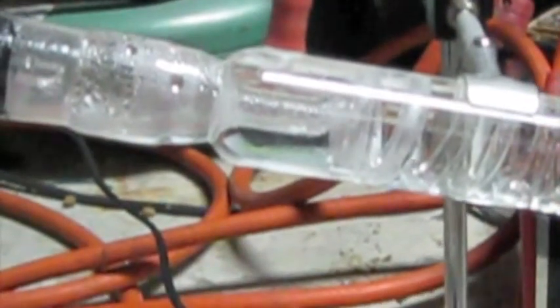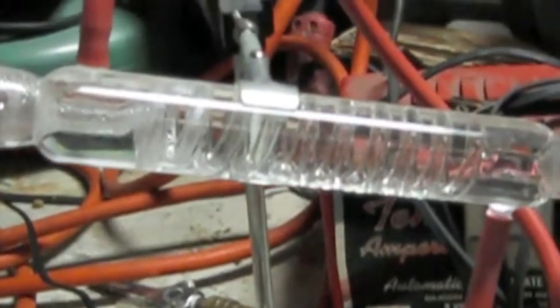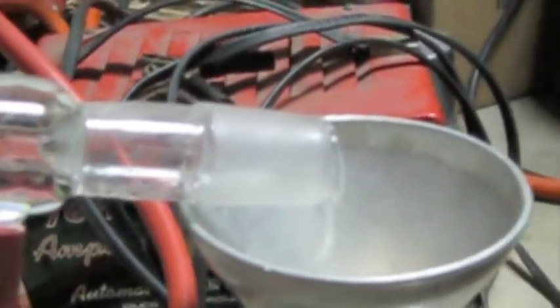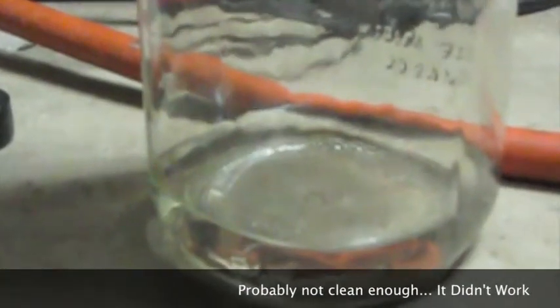How would you know you have distilled? Because I can see it and I know chemistry. Yay, chemistry. Hydrogen's clear. What do you think the thermometer is in there for? To measure the temperature. Which is 100 degrees C. The vapor pressure pushes it along this little tube and then it eventually reaches here.